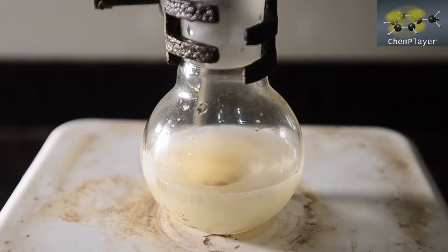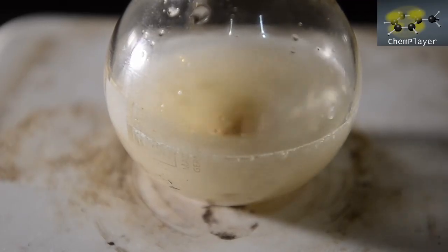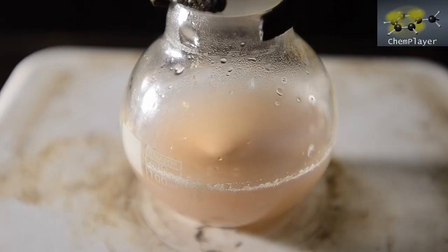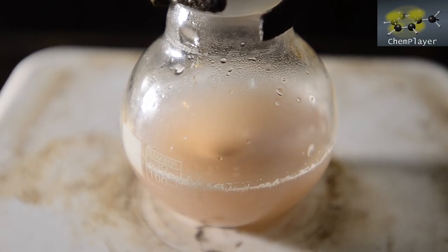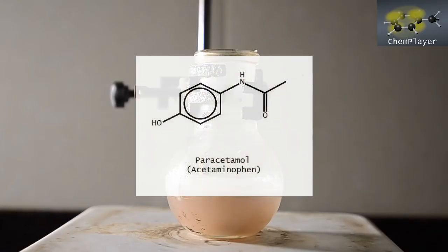Some of the solid seems to have dissolved as you can see, but let's see what happens when we heat. Well, the solid mostly seems to go into solution, and we've also got a faint pink color appearing in the mixture as well. Let's leave this to warm up slowly and see if we get a reaction. We've covered a mechanism for alkali hydrolysis of amides in a previous video, so check it out for more details.